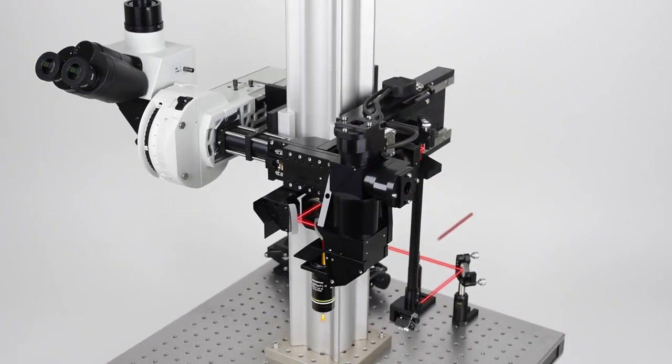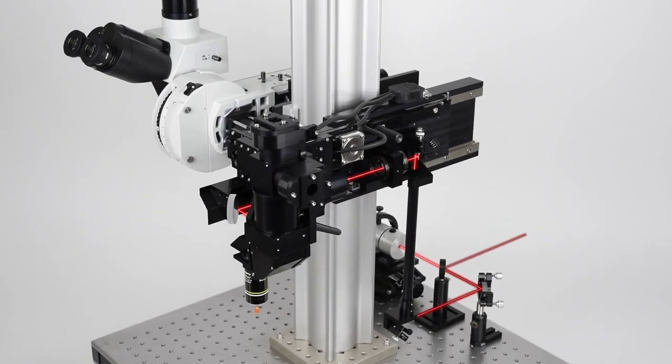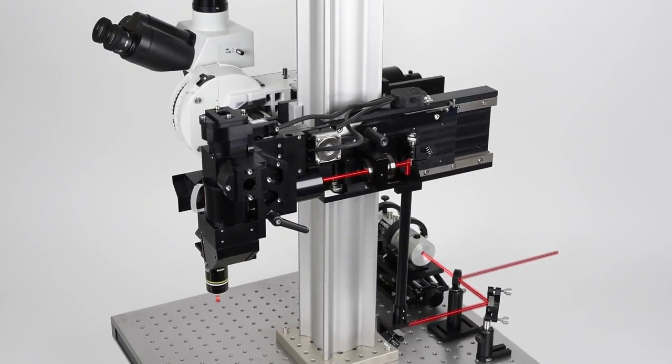2 separate laser beams can be arranged on the optics table with individual Pockels cells and recombined into the system as well. In this case, the 2 beams can be independently modulated by the software for simultaneous multi-line excitation, fast photo manipulation, such as optogenetic stimulation, or molecular uncaging.